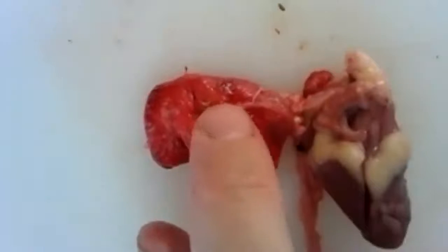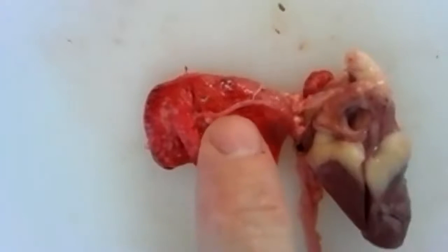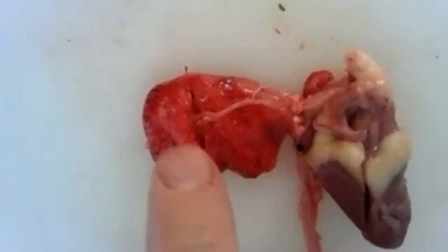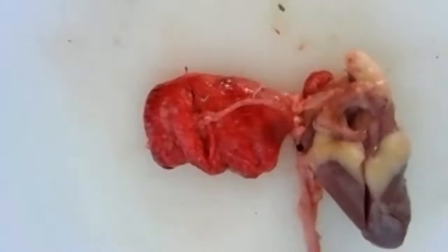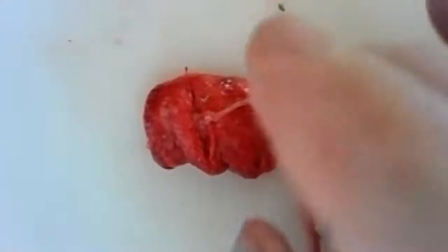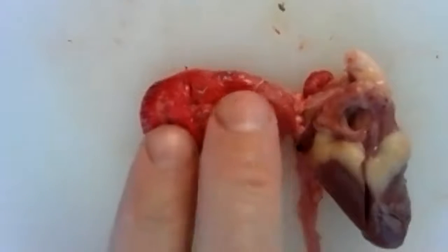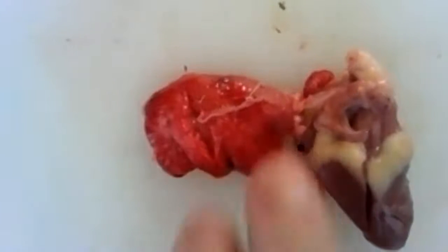Okay, so it's so soft and squishy because this lung needs to expand greatly and contract again to get oxygen into the lung and then back out of the lung, okay? So it's got to move that in there. To do that, it's got to expand. So it's a really, really soft, squishy, very delicate organ.